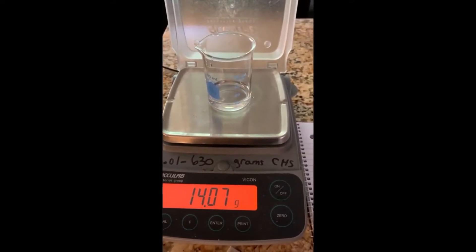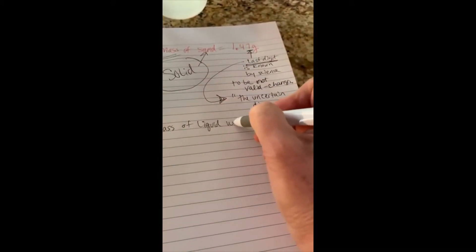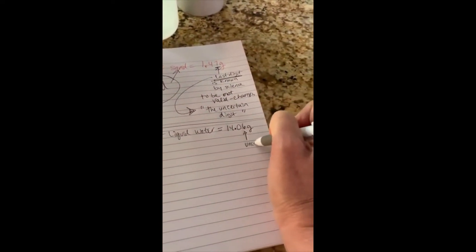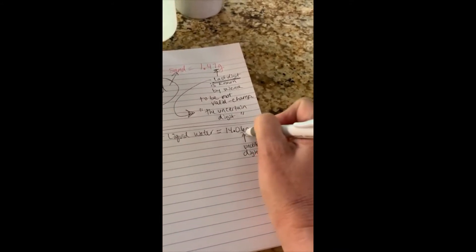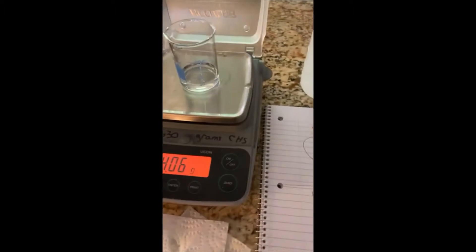So that's 14.06 grams — that's the mass of the liquid water. And again, this is the uncertain digit, so the last number you always write, even if it goes up and down. Write down the one that stayed on the most. It's still stuck on 14.06, so that's what it is.